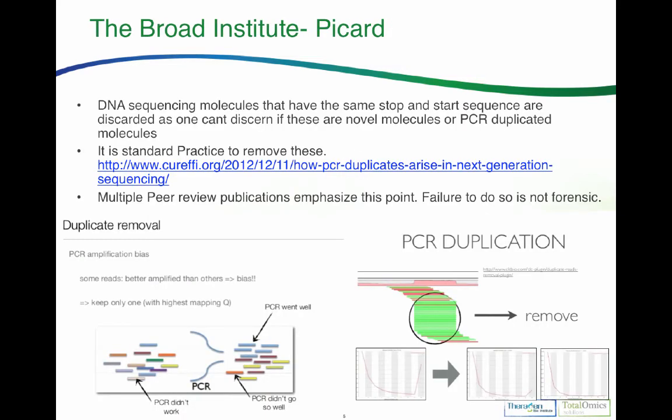Okay, so let's talk about how people handle these PCR duplications. The Broad Institute is one of the premier facilities for doing DNA sequencing, and they wrote a program called Picard. And Picard is something that goes through and scans for PCR duplication events and removes them. Here's an example: you've got reads starting in the green going in one direction, the red going in the other direction, but they start and stop at defined locations. So you know each of these were derived from a unique molecule.